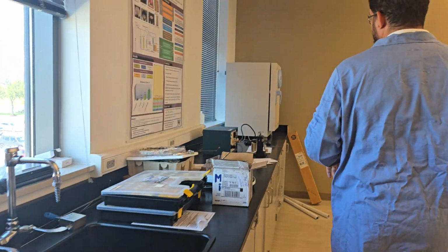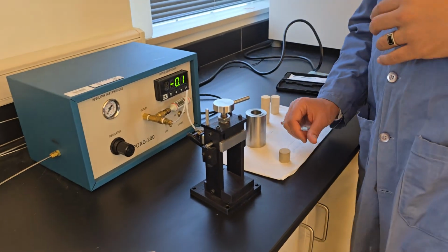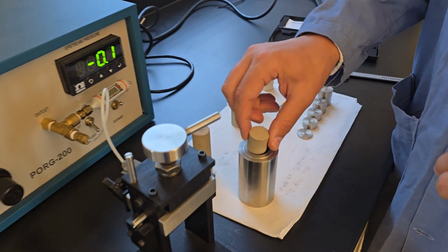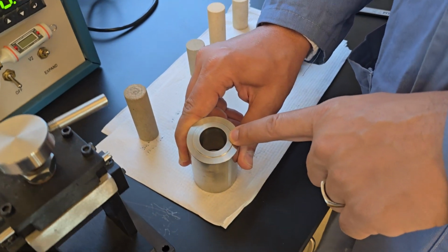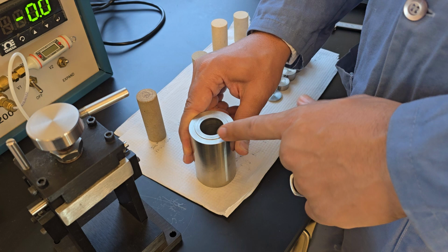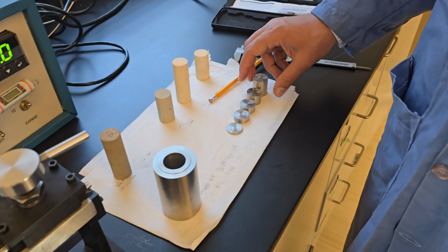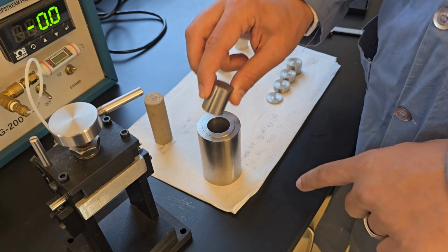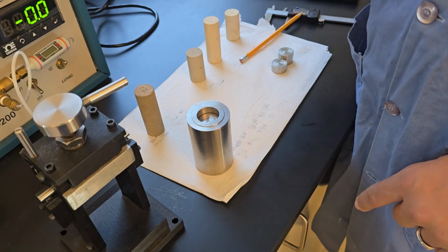Next step is to prepare the sample to run. Now we get the core sample, and when we put the core sample in the container right here, we get so much void space. If we continue our experiment like this, all this extra void space will be counted as porosity or pore volume. To avoid this, we use these steel test discs. We want to find the best mix of these discs that will fill up this space to the top. I'll start with a big one, then the second smallest one, followed by the smallest one.